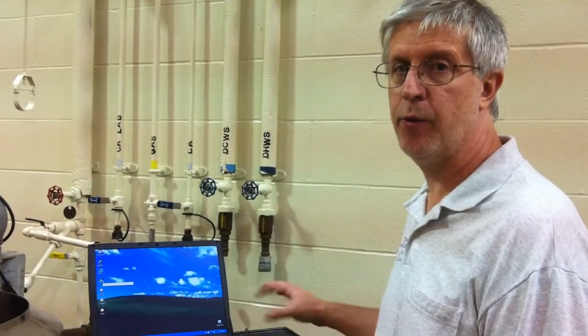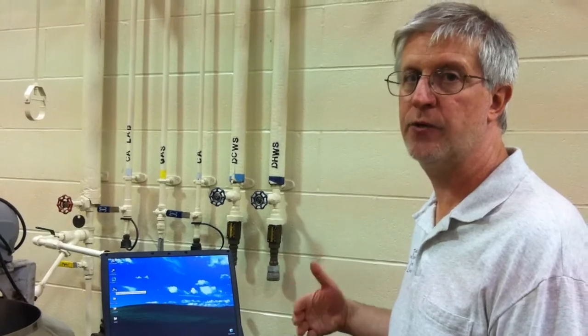Okay, we will now demonstrate how to take the data from the data logger that we uploaded to the computer and do the analysis so we can get pH versus time.